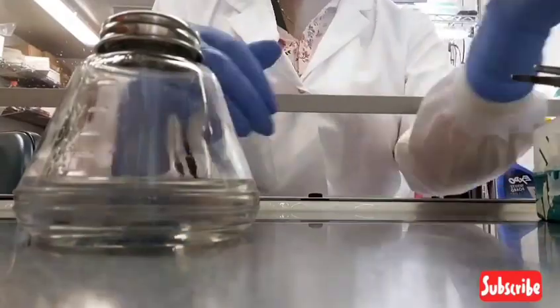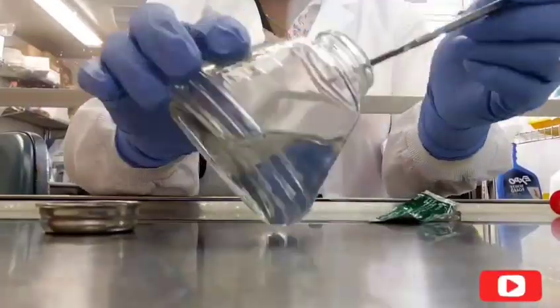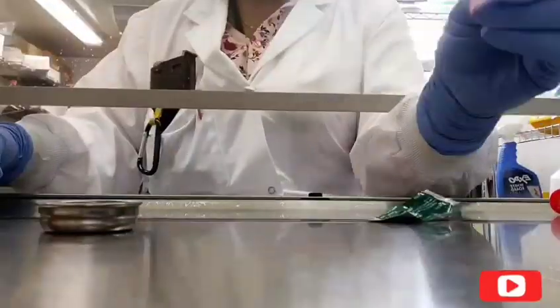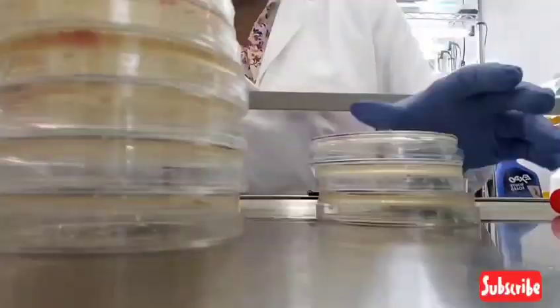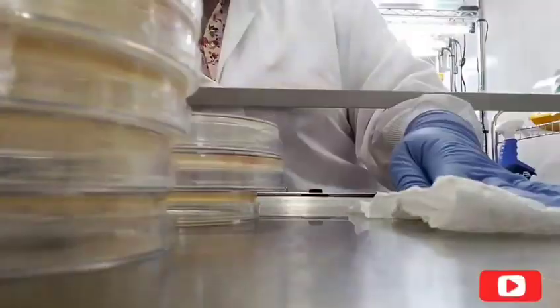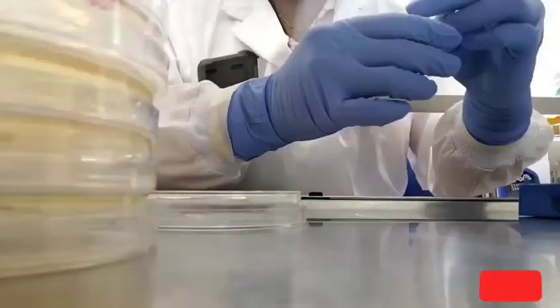So that's my forceps and my scalpel. They'll be heat sterilized using ethanol and then putting it into the flame. Let it cool. While it cools, I label my agar plates, which is just a standard potato dextrose agar used for growing pretty much all cultivable fungus.